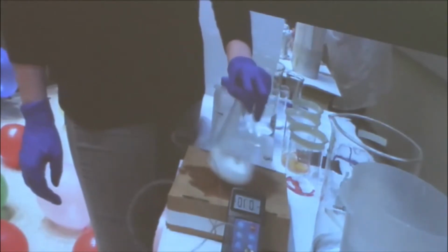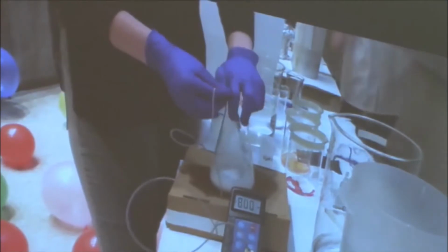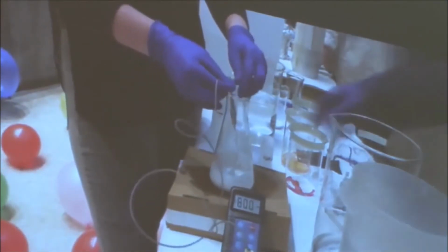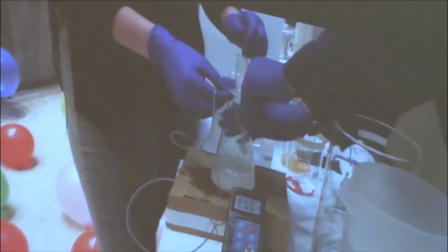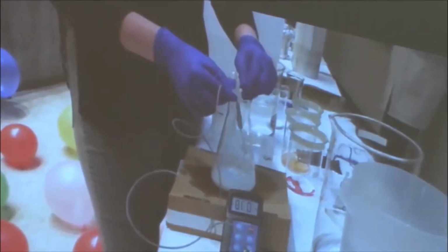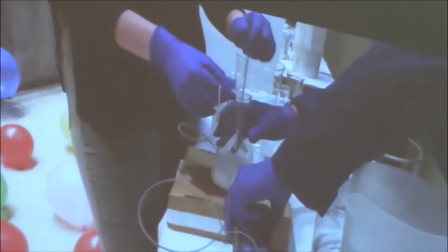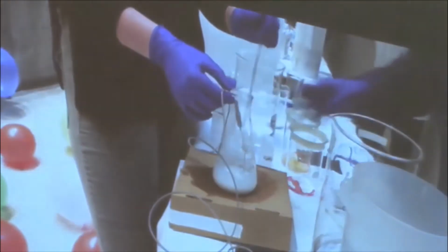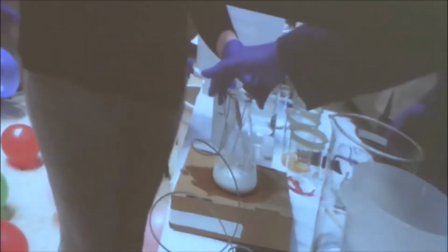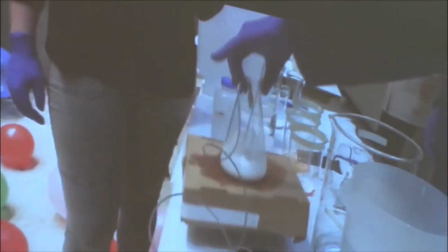Okay, that is 0. It's negative 12, negative 13. So it took so much heat that the water on the cardboard got frozen, and now I will try to lift it. And the cardboard is attached because the water freezes. You see?